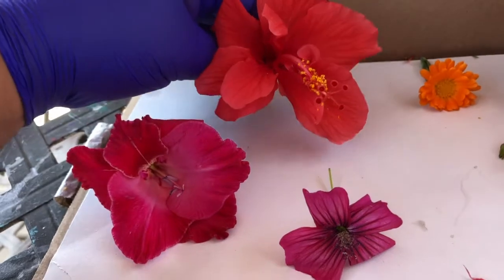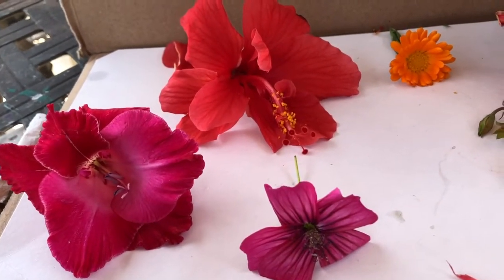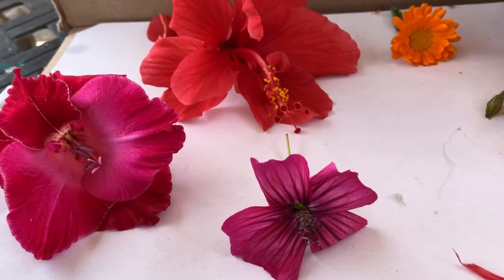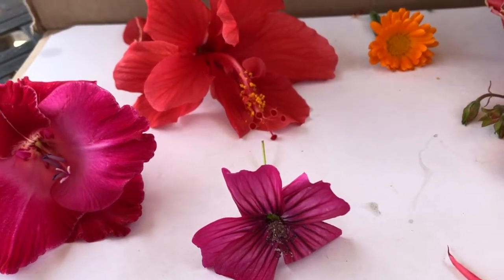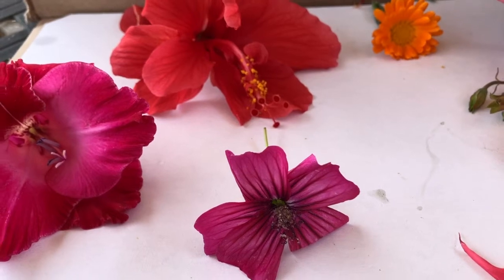And all the while pollinators receive a reward of nectar while they're getting into the flowers, they're ultimately having to pay the price by getting some of this pollen and then taking it to other flowers so that other flowers could then reproduce and bring forth fruit of some sort. So today we're gonna take you real quick through the anatomy of a flower.